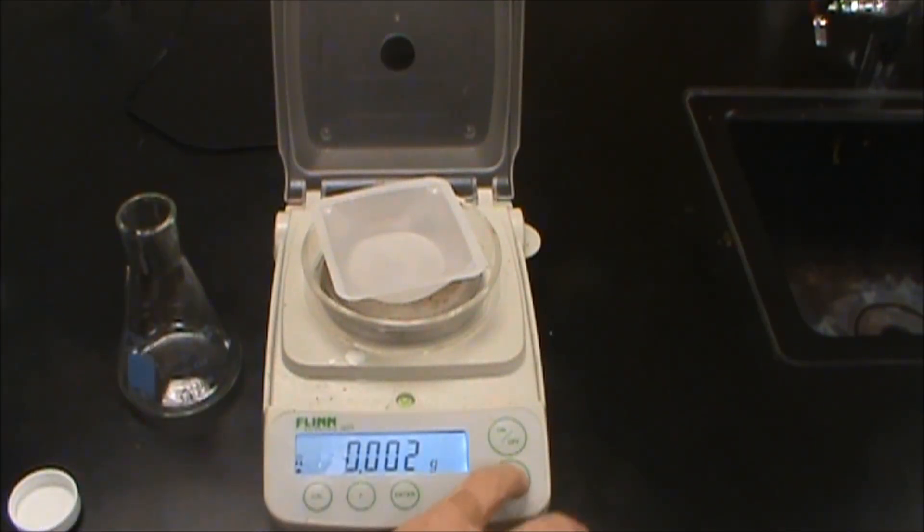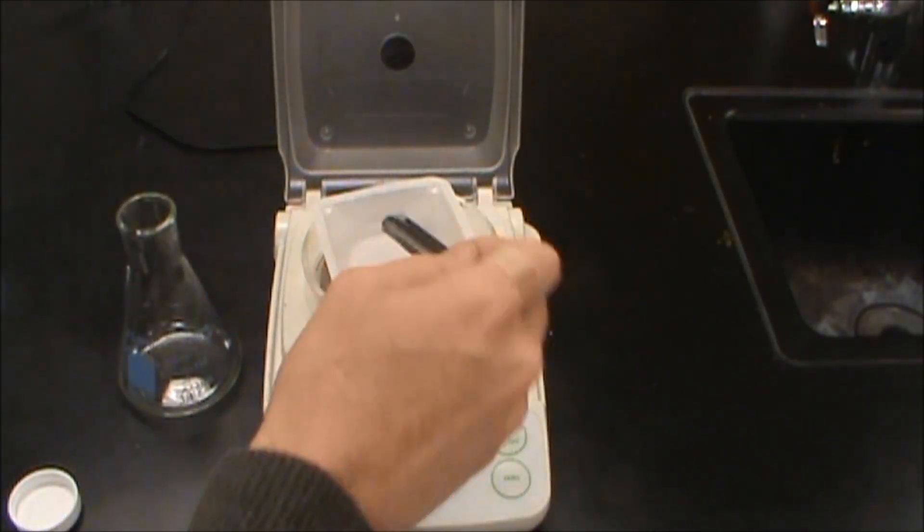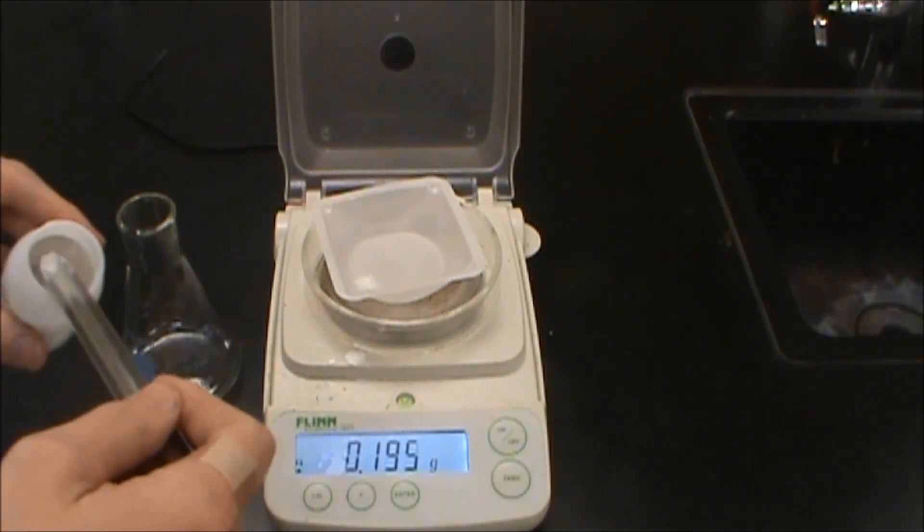So the first thing we're going to do is we're going to measure out about 0.5 grams and I'm less concerned with the amount that I actually get and more concerned with how much makes it into the flask.